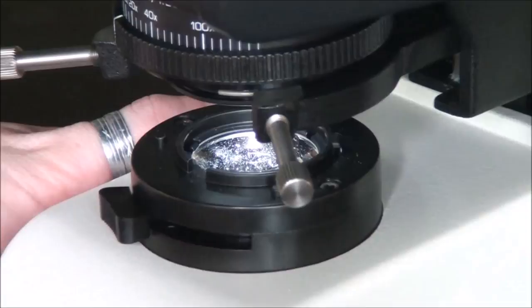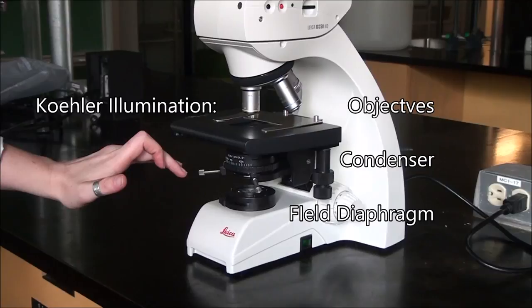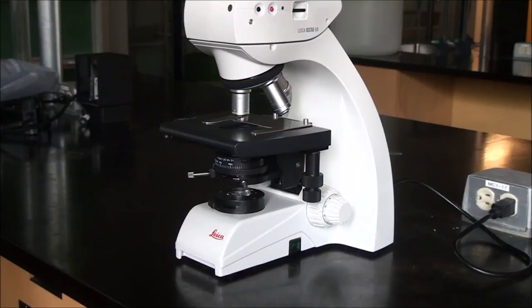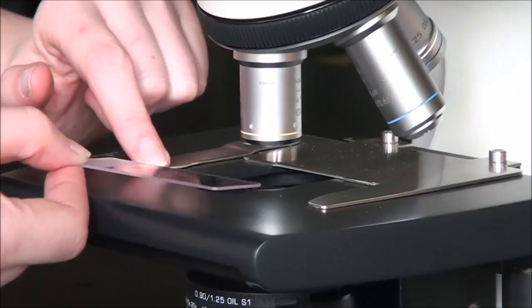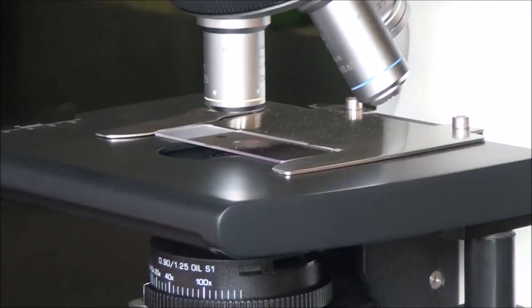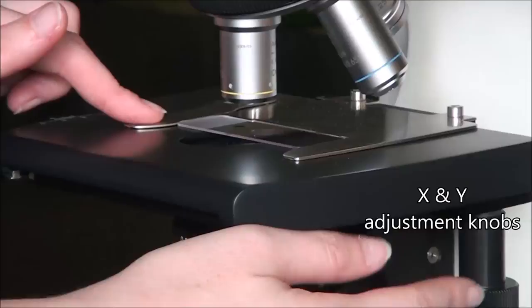Make sure the objectives, condenser, and field diaphragm lens are all in focus for the focal plane that your sample is on, which for us is going to be a glass slide. We're going to slide the little stage holder just out of the way enough that we can get our slide into position and locked into place. The nice thing is we can now control the movement of that slide using the X and Y adjustment knobs.